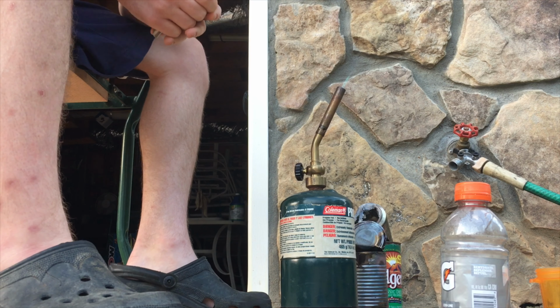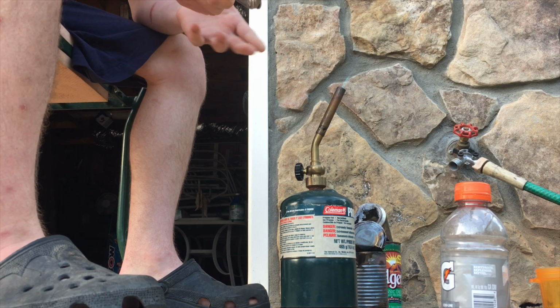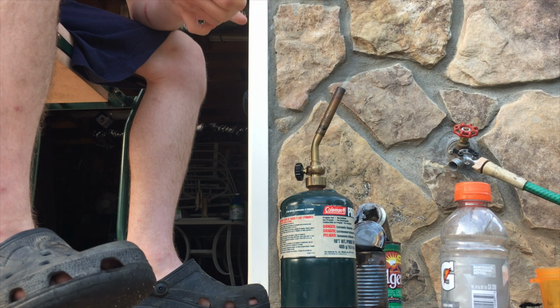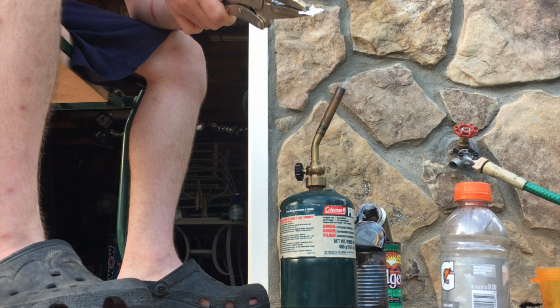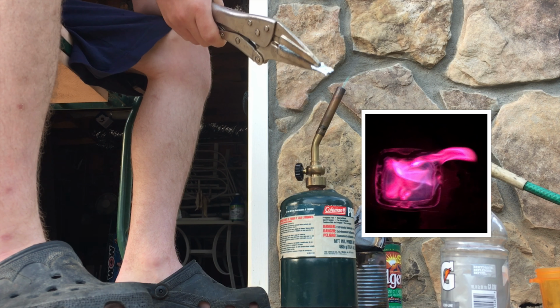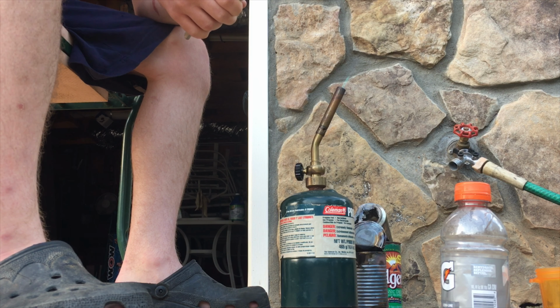So one thing you can tell about zinc is that all metals usually have some sort of ionization flame color, kind of like with lithium we saw that magenta flame. Zinc, I think, has almost like a light blue, almost whitish flame.